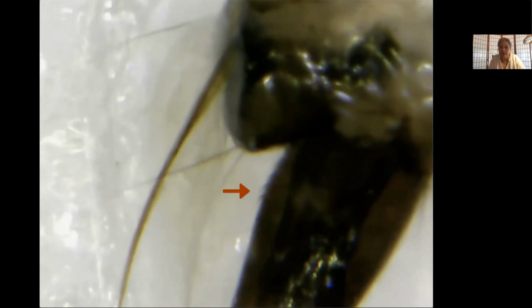And now I wanted to show you, so now we are focusing our attention above. You can see the pecten on the edge of the siphon there. But what I want to call your attention to now is the terminal anal segment, which we can also call the tail. And what you see there is the saddle.